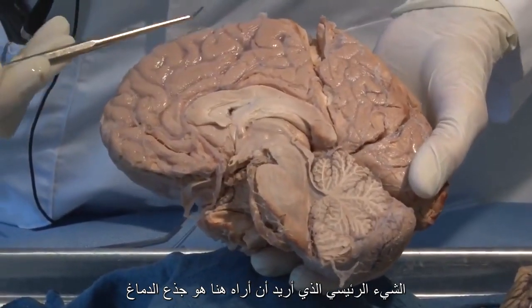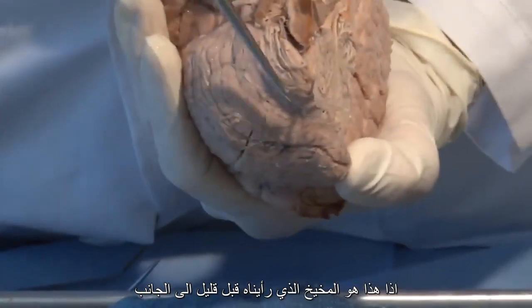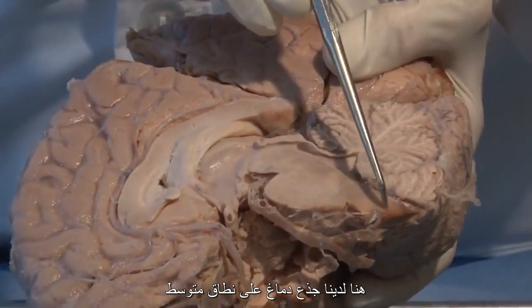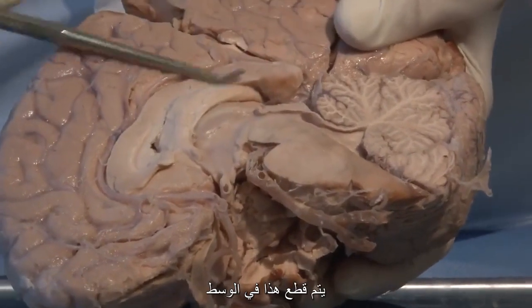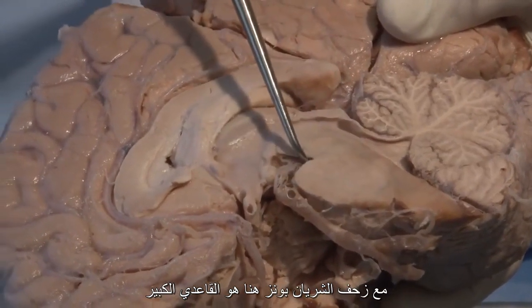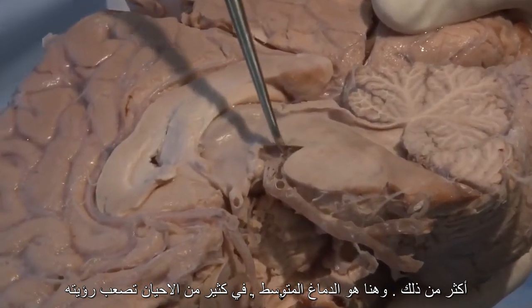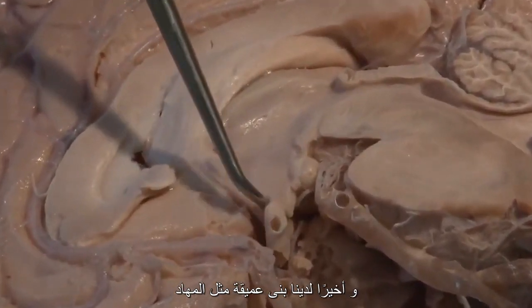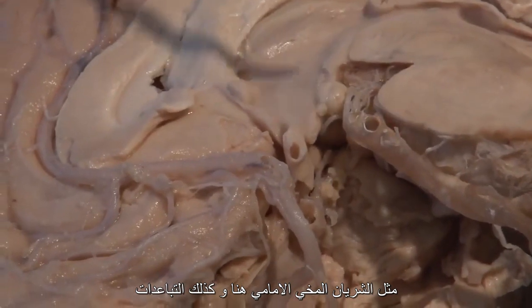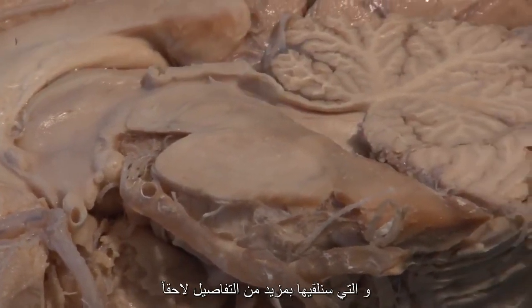The main thing I want you to see on this brain is the brain stem. So this is the cerebellum that we saw before out to the side, and the brainstem, recall, was in the middle. Here we have the brainstem on a mid-sagittal. This is cut in the middle. So this is a mid-sagittal section. Here's a bit of the medulla. Here is the pons with a big basilar artery creeping up over it. And here is the midbrain, often hard to see. And finally, then we have deep structures such as the thalamus. And we can see many of the vessels like the anterior cerebral artery here, as well as spaces such as the ventricular system, which we'll look at in more detail.